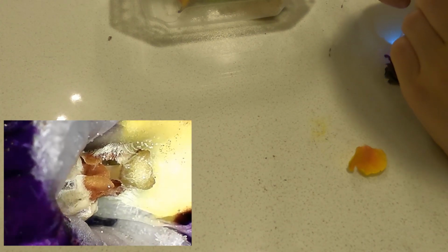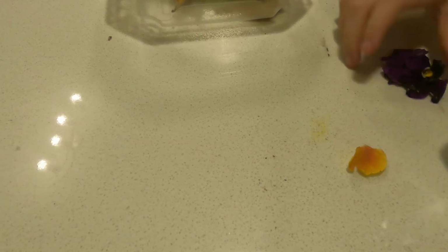Henry, come here. This is crazy. This is insane. What? This is like an ad to science. Let me see. Henry, can you hold your finger out so I can look at the ridges on your finger? I can't believe you picked up a straw though. I know. It is so funny.